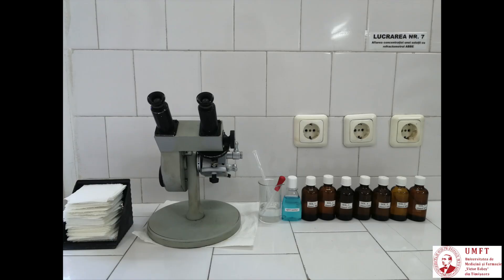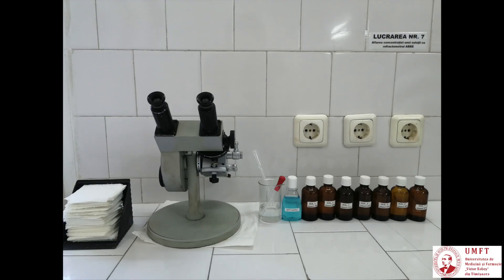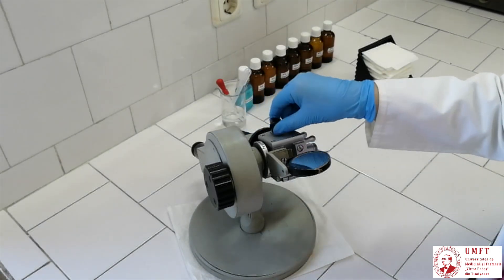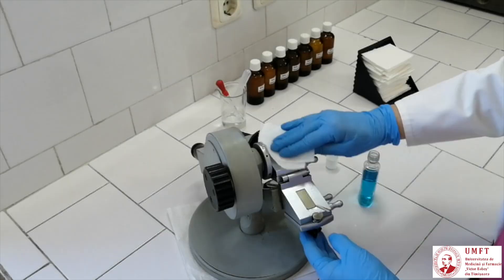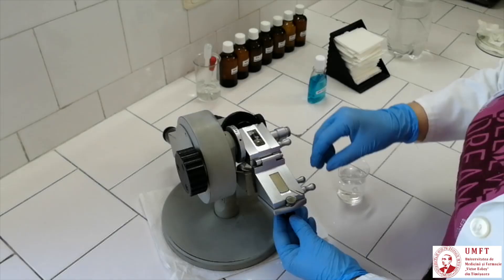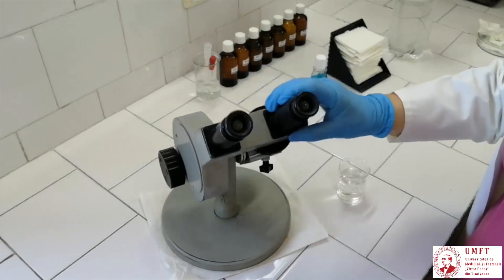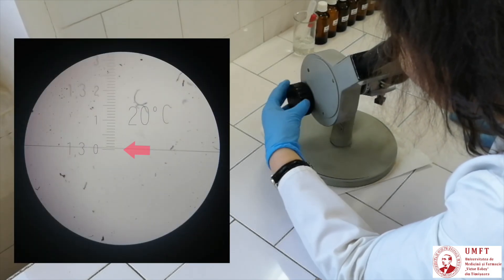For starting, check the calibration of the refractometer. For this, use distilled water, since its refractive index value is known. Rotate the refractometer from the reading position to the upside-down position. Open the screw and separate the surfaces of the two prisms. Clean the two surfaces with rubbing alcohol. Add several water drops on the illumination prism. Rotate the second prism back over the first and lock it in place with the screw. Turn back the refractometer to the reading position. While looking through the reading eyepiece, rotate the big thumb wheel until reaching the end of the scale.